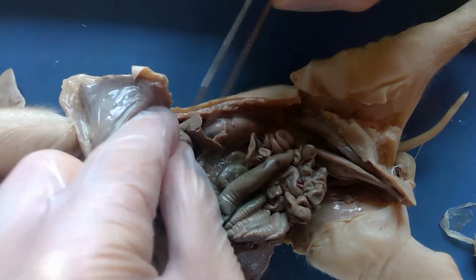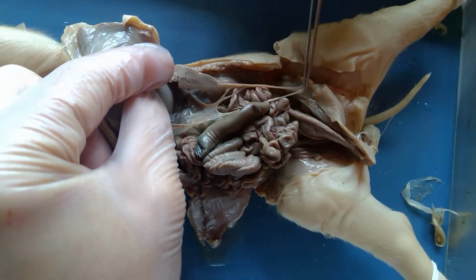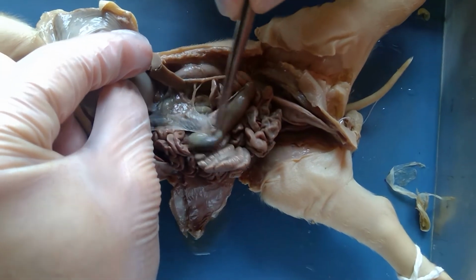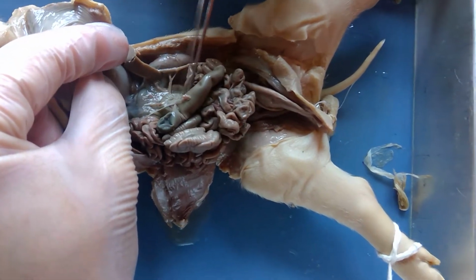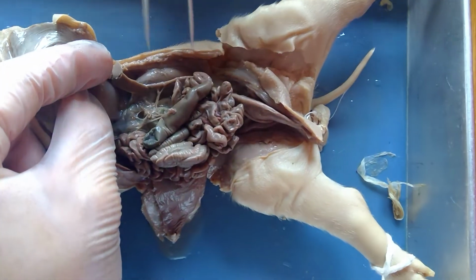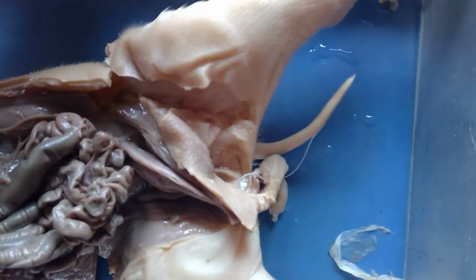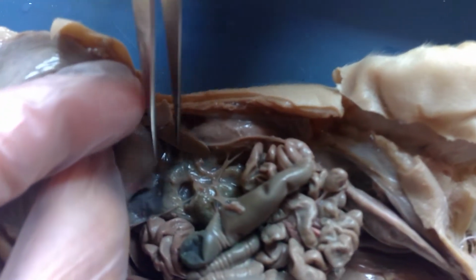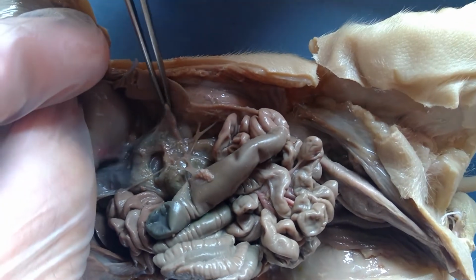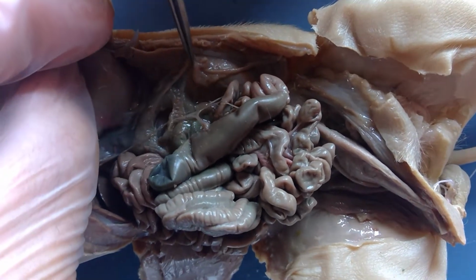If I pull the stomach away and look underneath, I'm going to start pulling away what is again called mesentery. It's in the same system as skin, and it protects all the different organs. I need to get in a little bit closer so I can see myself. I'm going to pull away mesentery because this organ I'm looking at right now is very fragile. This right here, if I peel away.